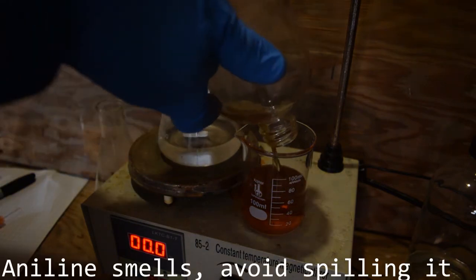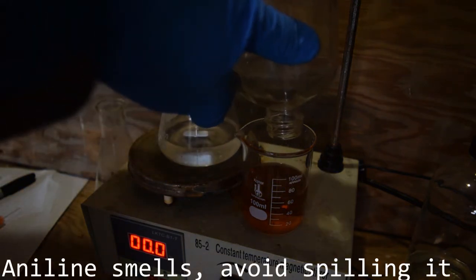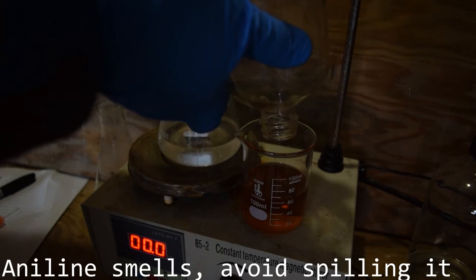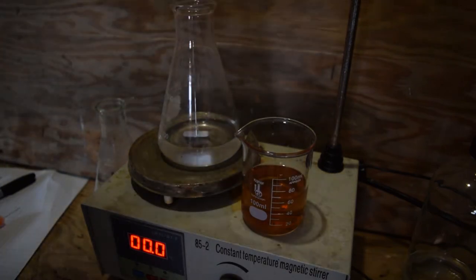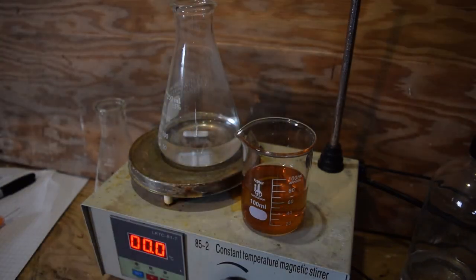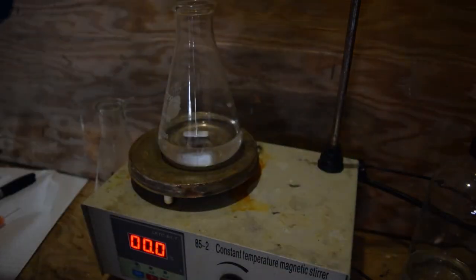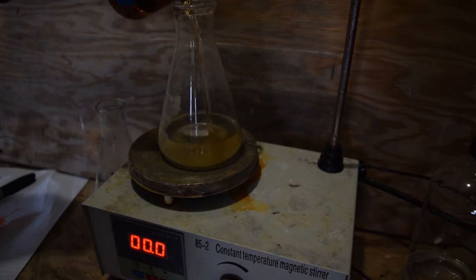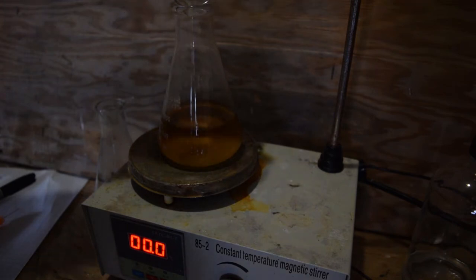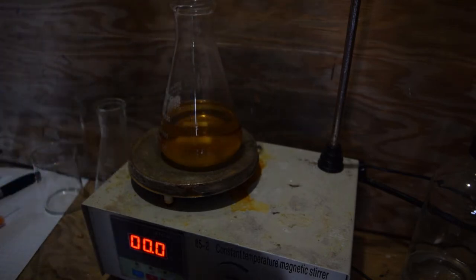Okay, this goes into the flask. And I'm going to turn on the stirring to completely dissolve it.